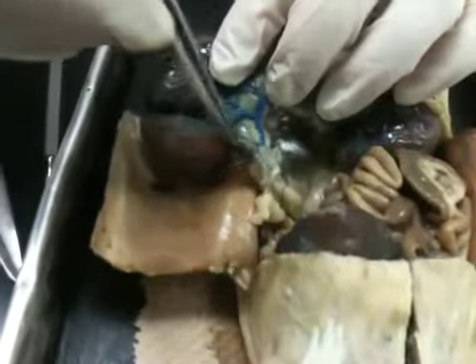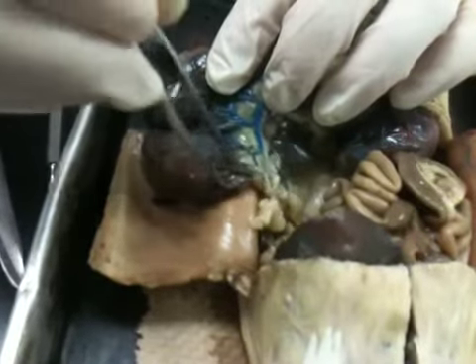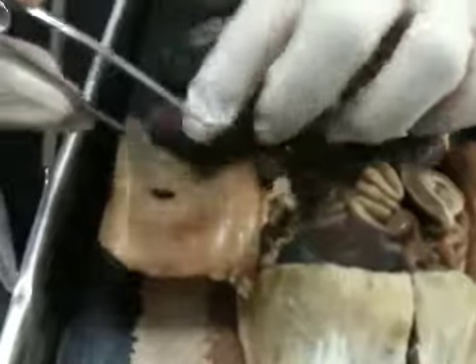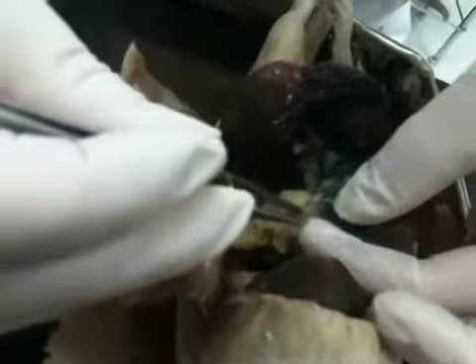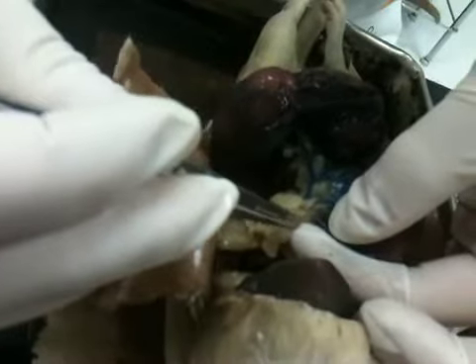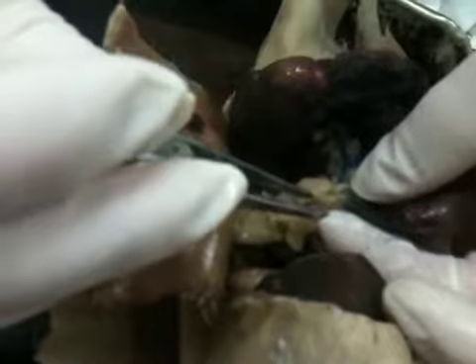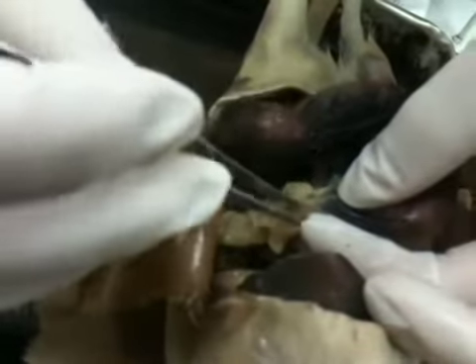This is the uterine horn, and we're going to look at a non-pregnant female, so you can see just how stretched out that is. And right up here at the top is this little squiggly ball. That is the ovary right there. So that's the ovary, usually bigger in a pregnant female, so we can see it much easier.